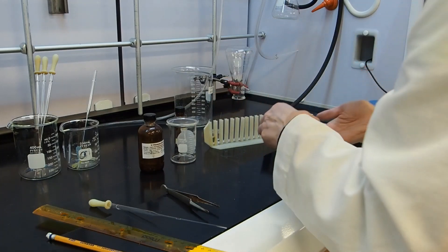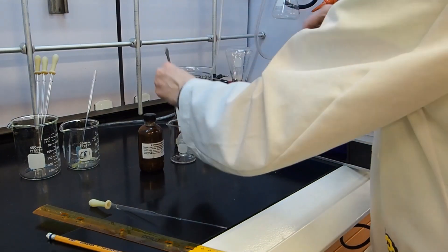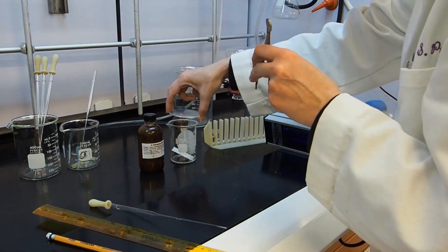Now being careful not to touch the surface of the plate, I'm going to use forceps to just drop it into the chamber and allow it to run for a few minutes.